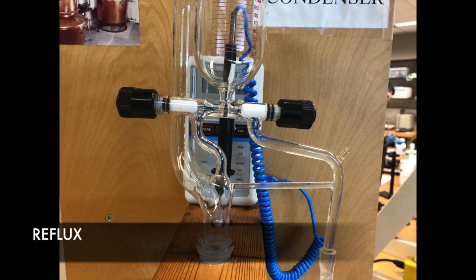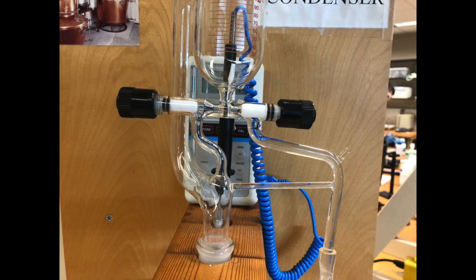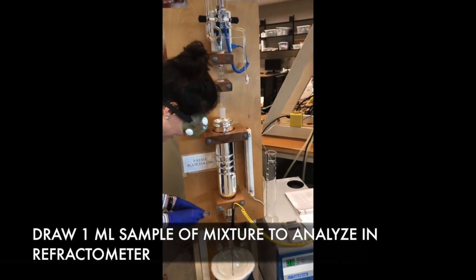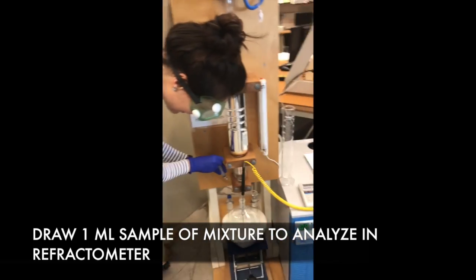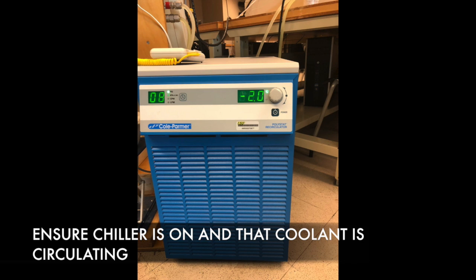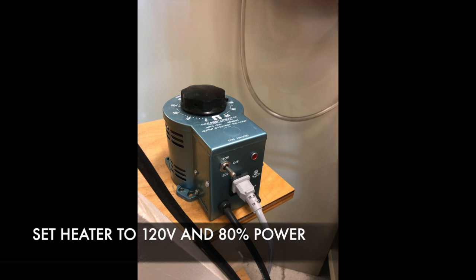Here we have our reflux, which uses valves to control the flow of the vapor that goes back down into the column, as well as the condenser, which condenses the vapor into the liquid. First, we will take a sample of 1 milliliter from the mixture to analyze in the refractometer. We will first begin by turning the chiller on, which needs to be on 20 minutes prior to beginning the experiment. I'll turn the heater on to 120 volt power and set it at 80%.